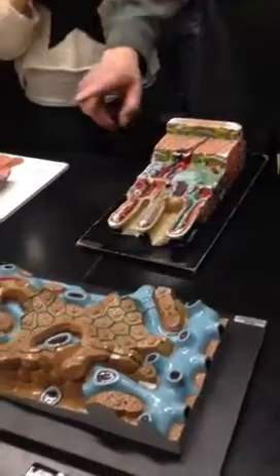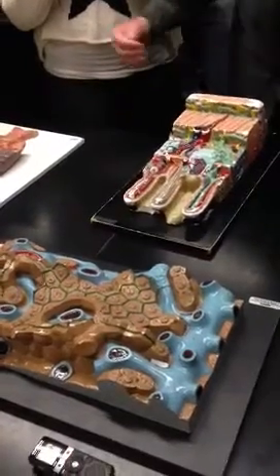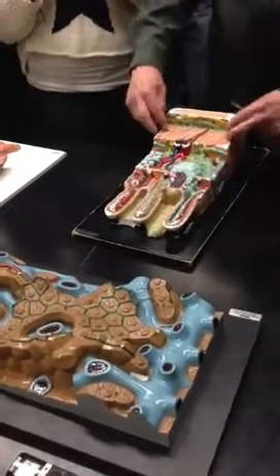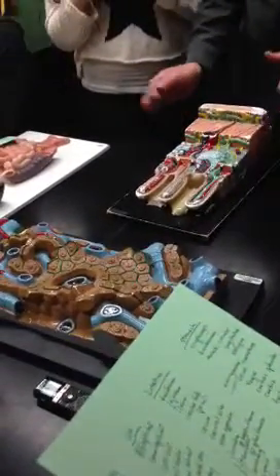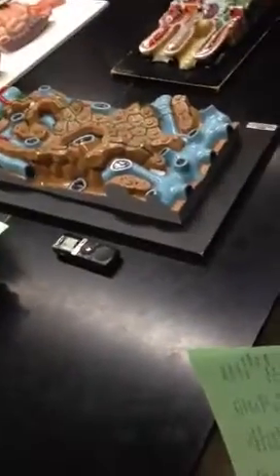Let's work our way this way. Here we have muscle that runs the length of the intestine. So this is longitudinal muscle. It's thinner than the thicker circular muscle. Okay. So you cut the circular muscle fibers this way, and you cut the longitudinal muscle fibers this way. Right? So we can dispose of those very nicely. The yellow things that you see here are part of the nervous system. I'll get back to naming those for you as we go in this direction.